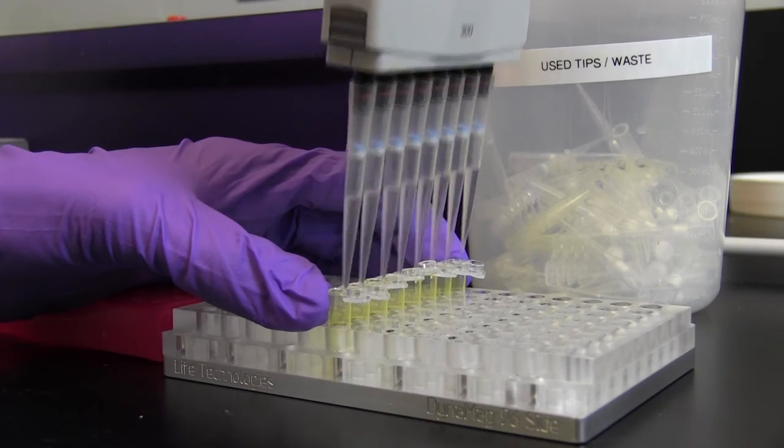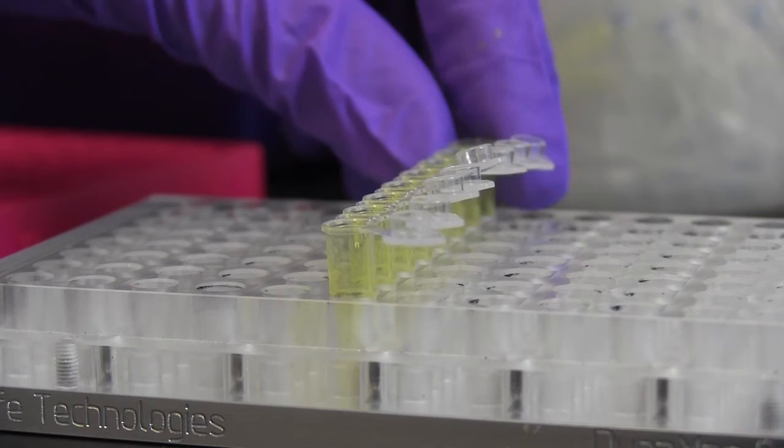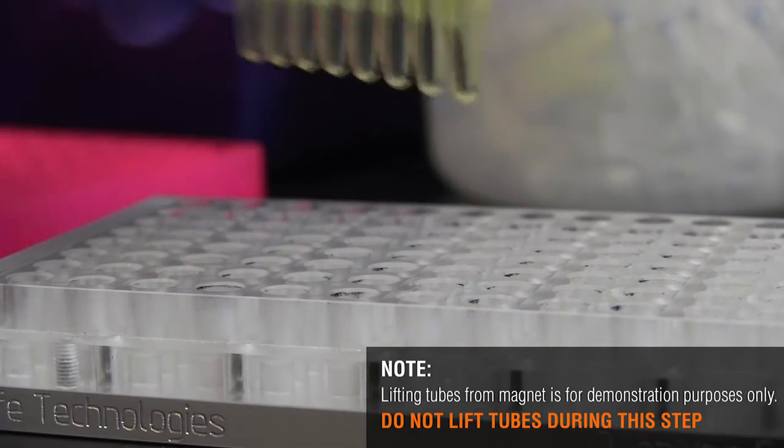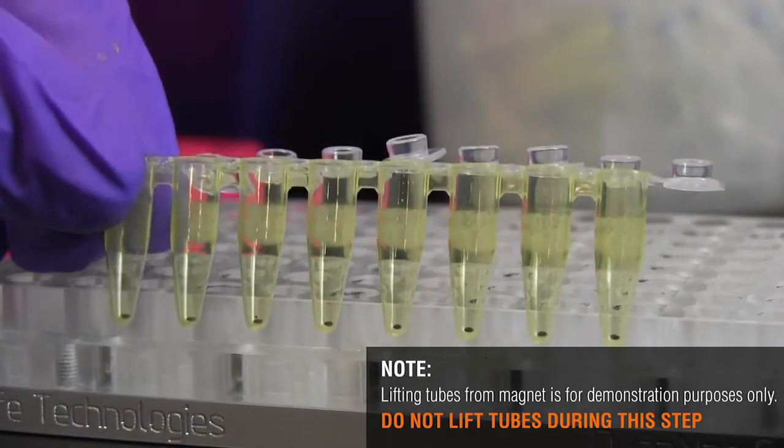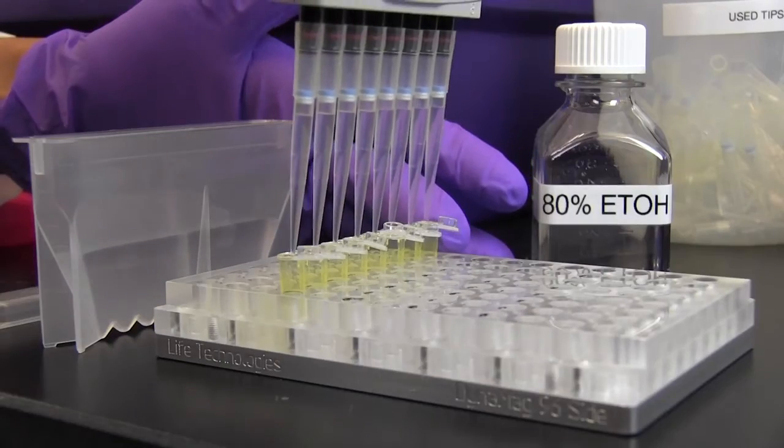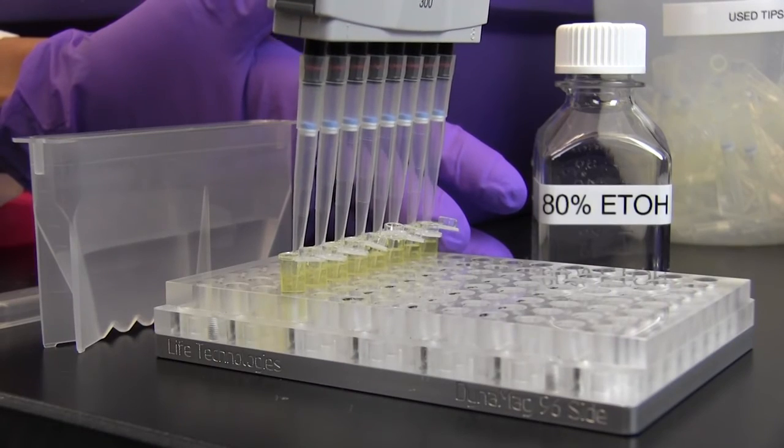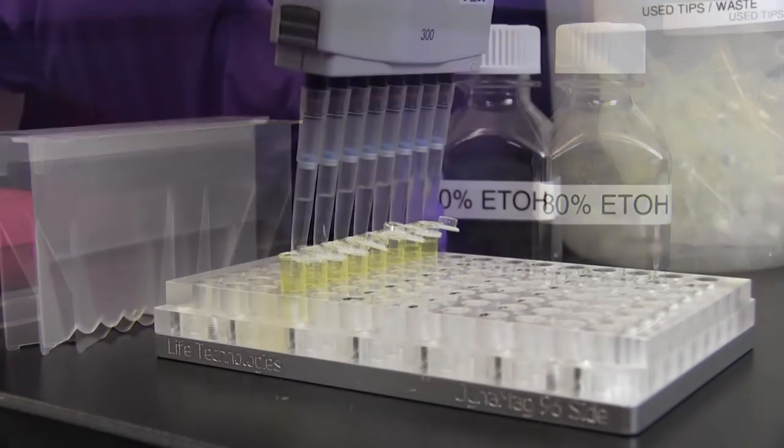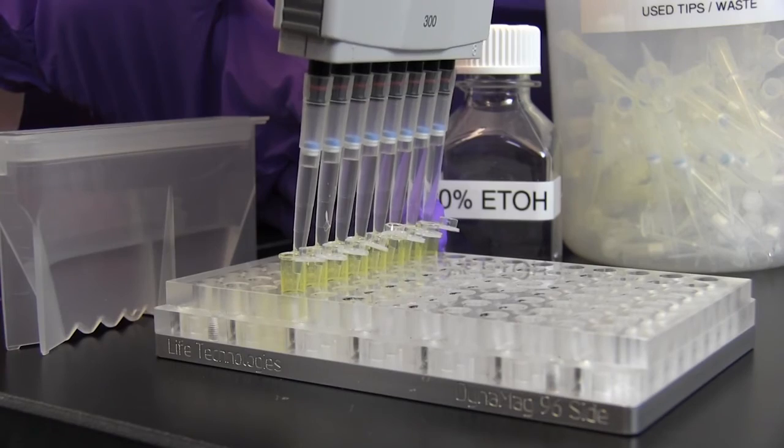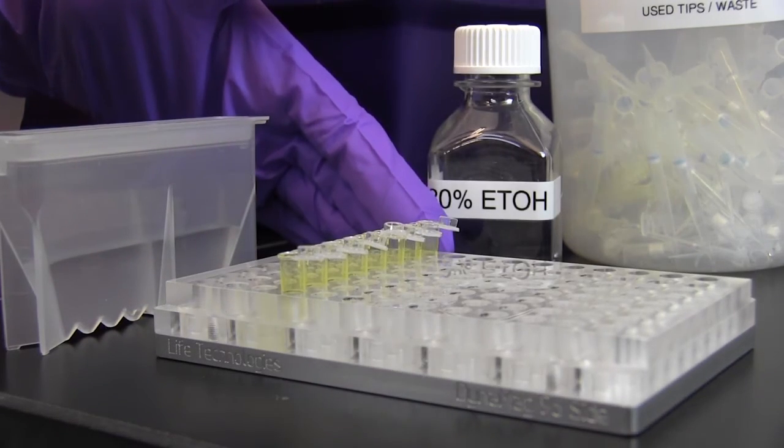After 5 minutes, remove and discard the supernatant without disturbing the bead pellet. Wash the beads with freshly prepared 80% ethanol as previously demonstrated. Allow the pellet to dry.